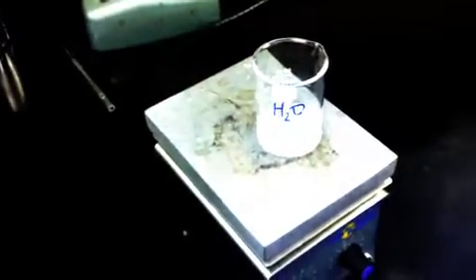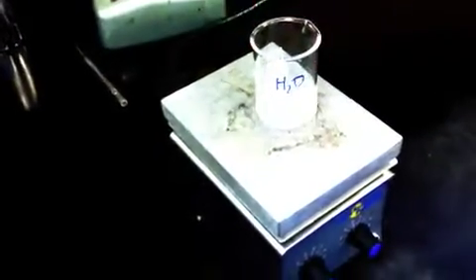So you can see when the water's heated up to almost boiling point, simmering point, that it still does not dissolve very much. It does not have increased solubility with increased temperatures. So that one we can rule out as being good.